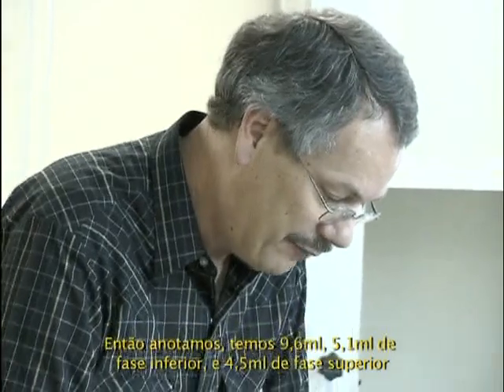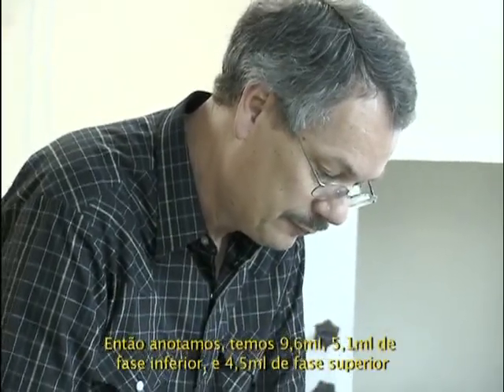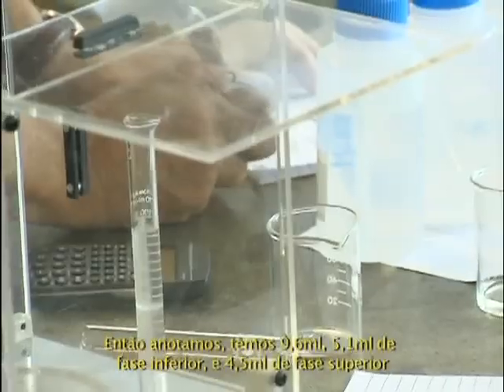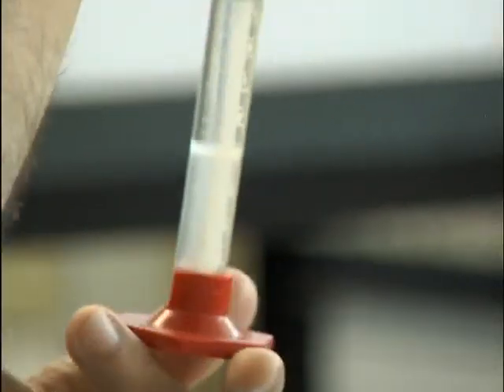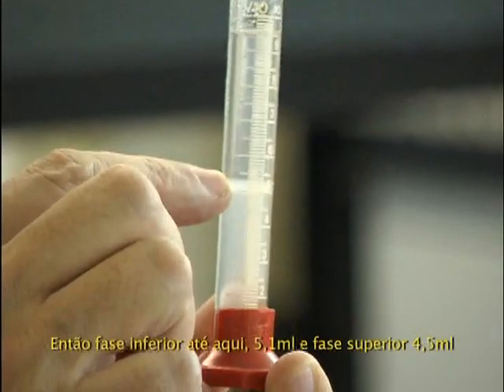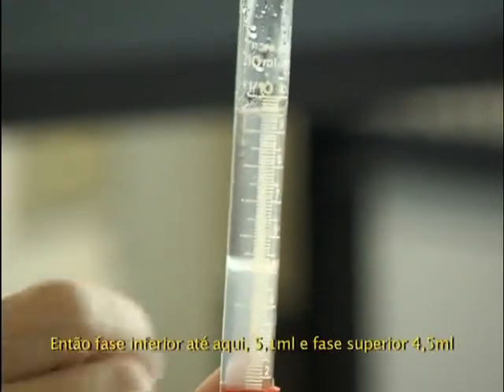So I write down, I have 9.6 milliliters, lower phase 5.1 milliliters, upper phase 4.5 milliliters. You can see the numbering there. So lower phase up to here, 5.1 milliliters, and upper phase 4.5 milliliters.